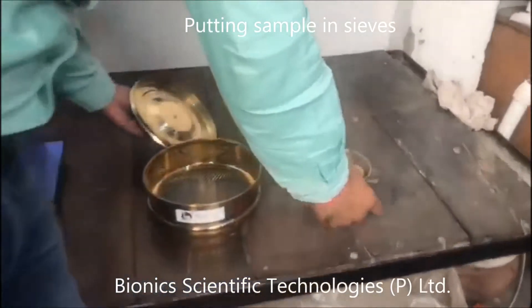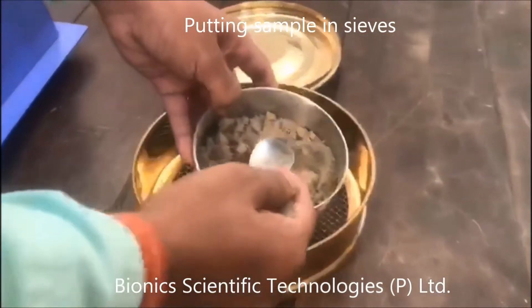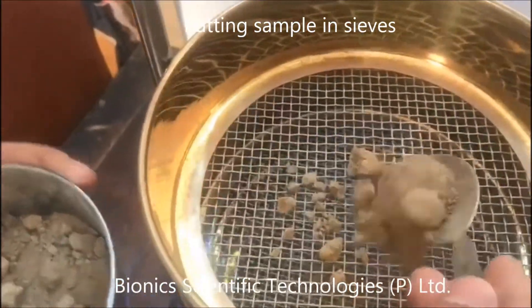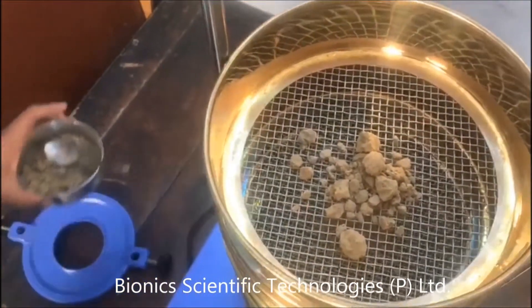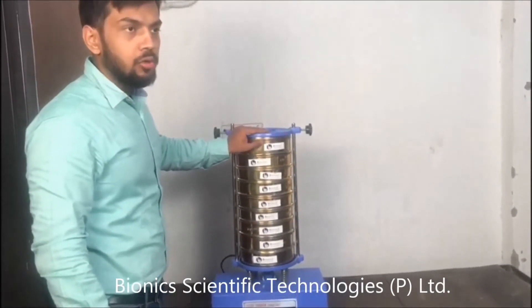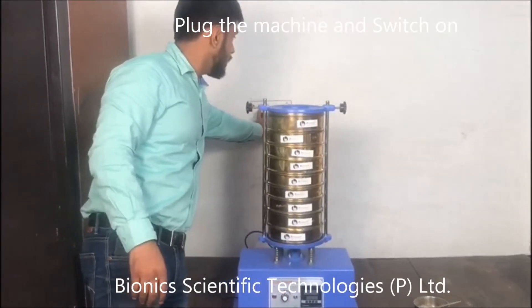Now what we are going to do is take this sample — it's sand — and we are going to place it in the sieve. That's how we've done it. As I have placed my sand in the sieve, I will now show you how to start this machine.